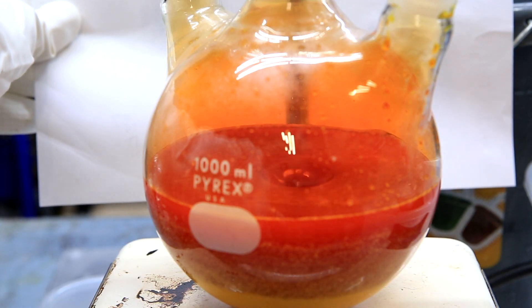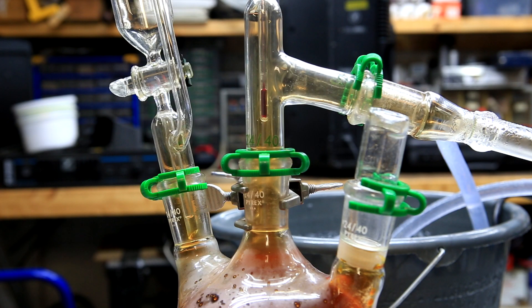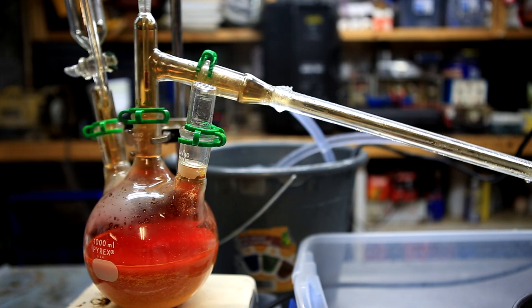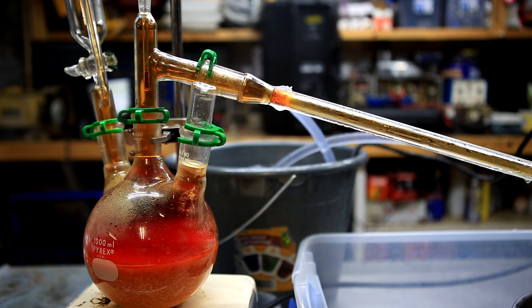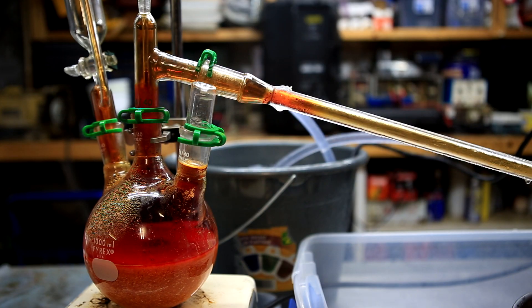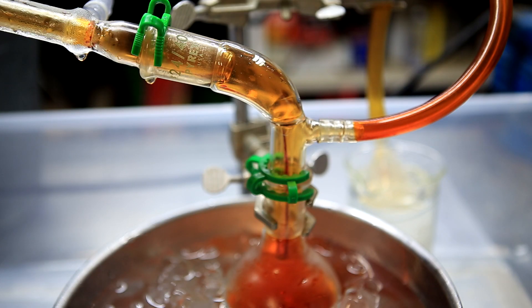In order to separate the bromine, we're going to have to carry out a distillation. You can see here that even before the distillation, there are evident bromine fumes, but there's not enough to condense into liquid bromine. As the mixture is heated up and more bromine is liberated, the vapors will become darker and darker. It will reach a point where the bromine will start to condense into liquid and travel down the condenser. Here we can see the first few drops of bromine reaching the end of the condenser column.